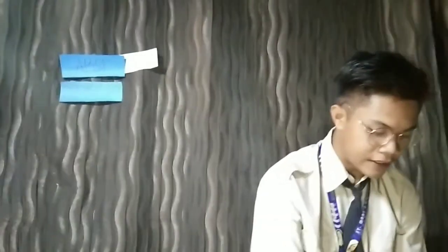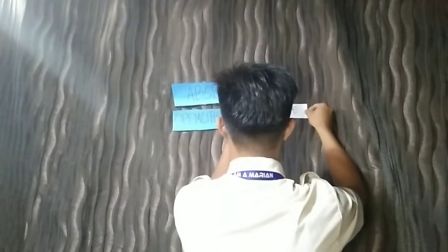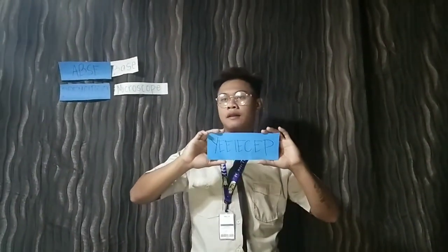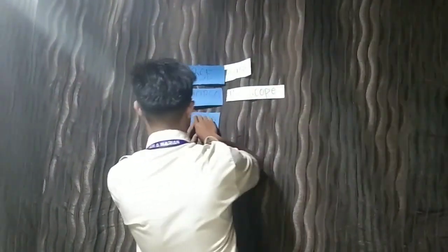Very good, class. You have a great idea about the microscope. Number 3. Okay, very good. It is eyepiece.